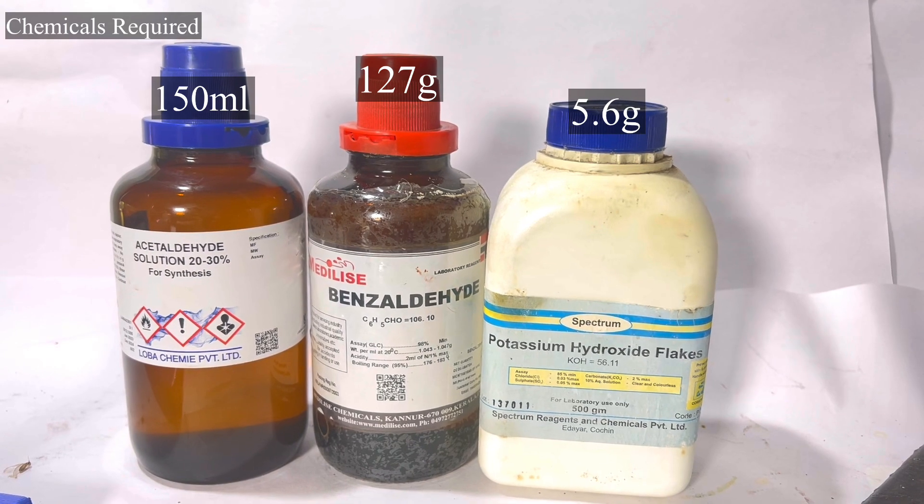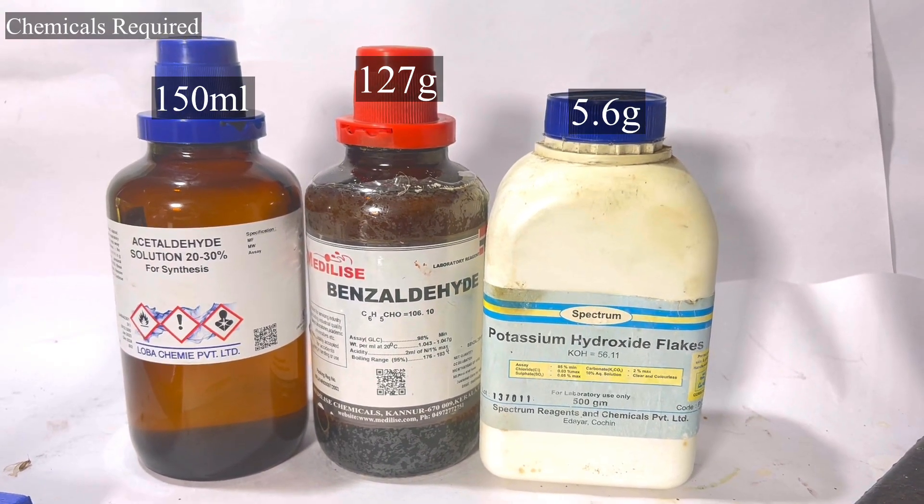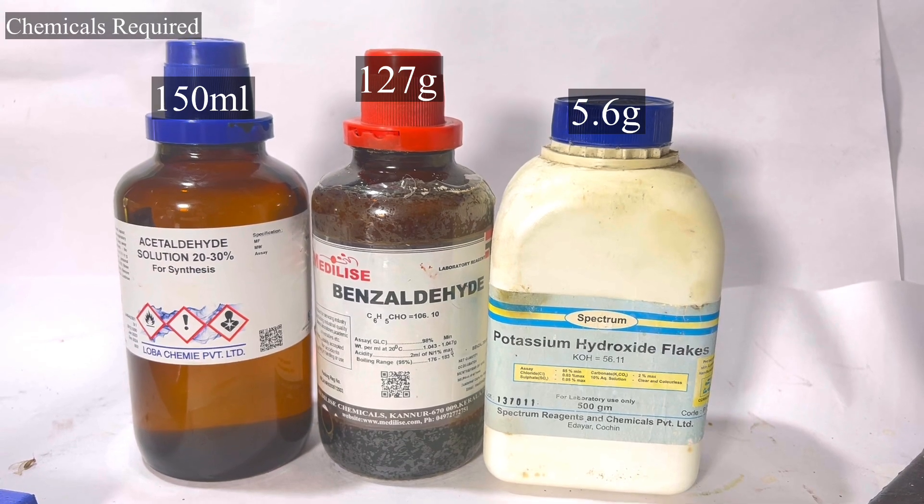I have taken a little excess of the 30 percent acetaldehyde solution just in case something goes wrong and acetaldehyde vaporizes.